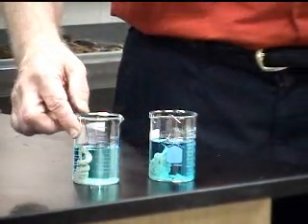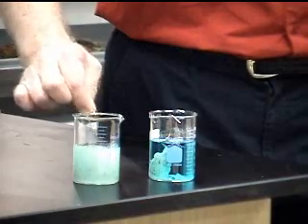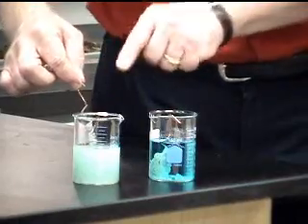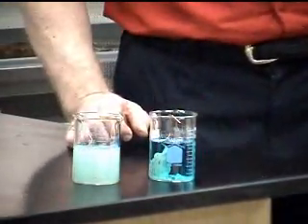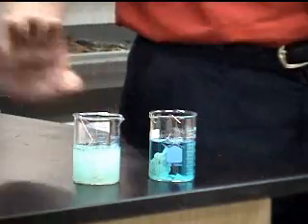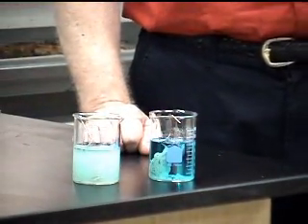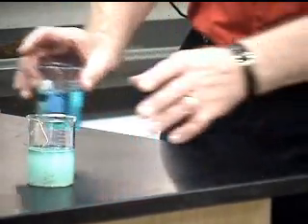What I am going to do is knock the silver off the copper coil. I will wash it all off, filter and wash this, and then we'll take a look at how much silver we actually get. Okay, I'm not going to do that here. I'm going to do that behind the scenes, and we'll come back and take a look at the amount of silver that we did obtain from the saturated solution.